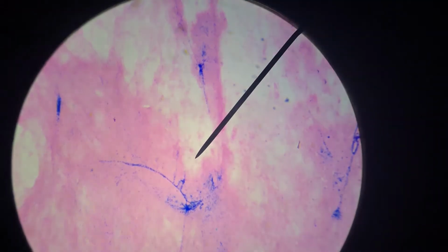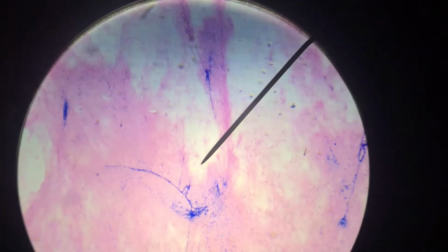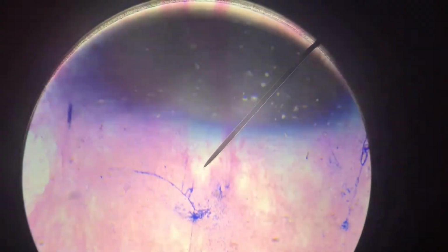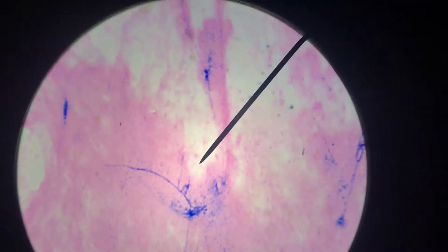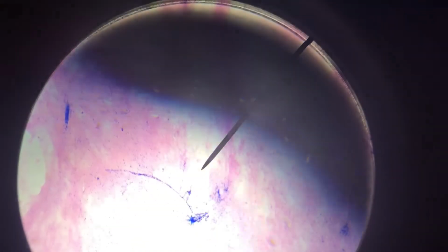So, yeah, you can see like the big cluster in the middle is the soma, and then you've got some dendrites leading onto there and an axon leading away. I wish that I could take my hand off the camera so I could move this pointer around, but alas, I cannot. You can look at Mastering A&P to see what neurons look like.